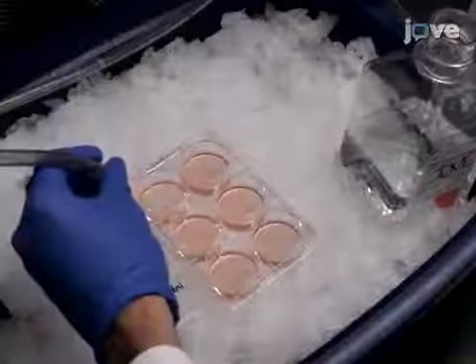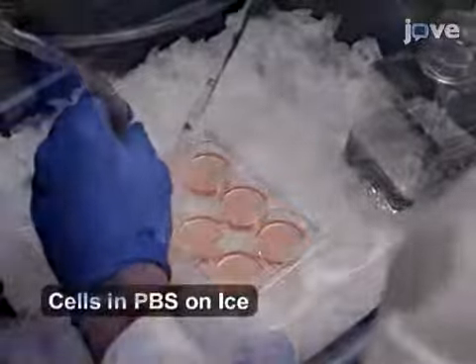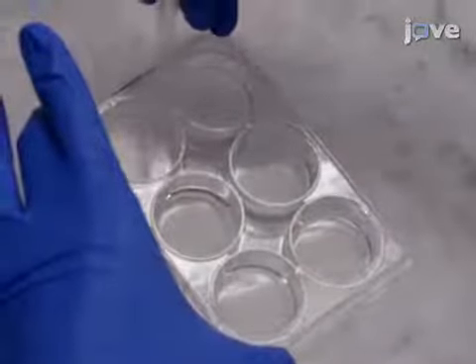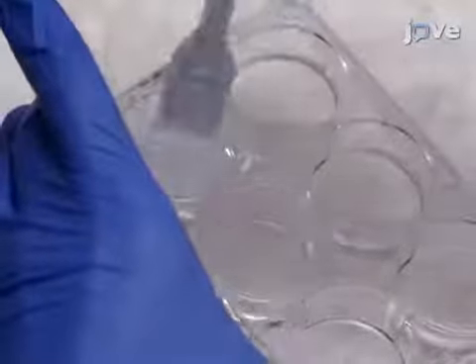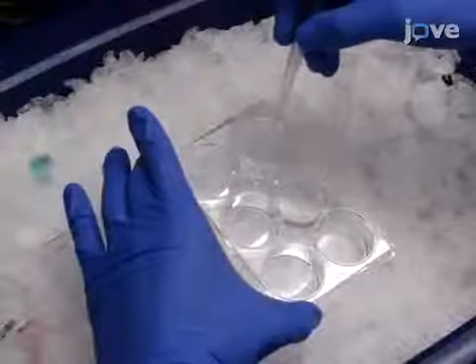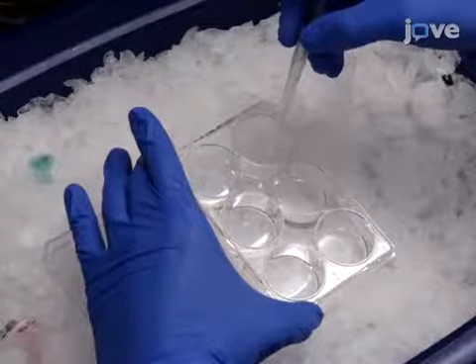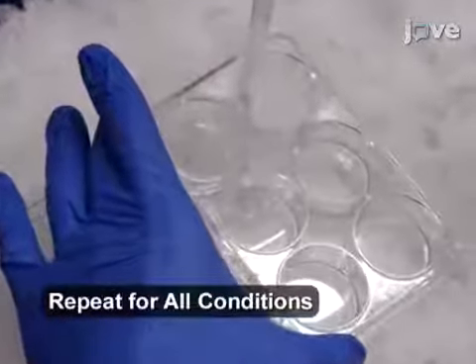After culturing and stimulating cortical neurons with Netrin-1, or a control according to the protocol text, aspirate PBS from the first well of a condition and replace with 250 microliters of homogenization buffer. Incubate on ice for 5 minutes, and then using a cell lifter, homogenize the cells on ice. Aspirate the PBS from the next well of the same condition, and add the recently homogenized mixture to the well, which will increase protein concentrations.